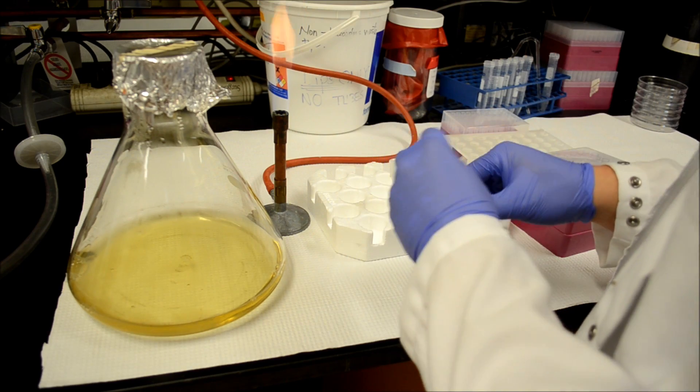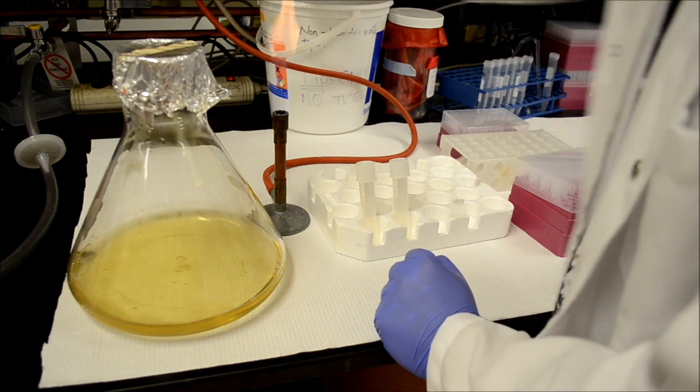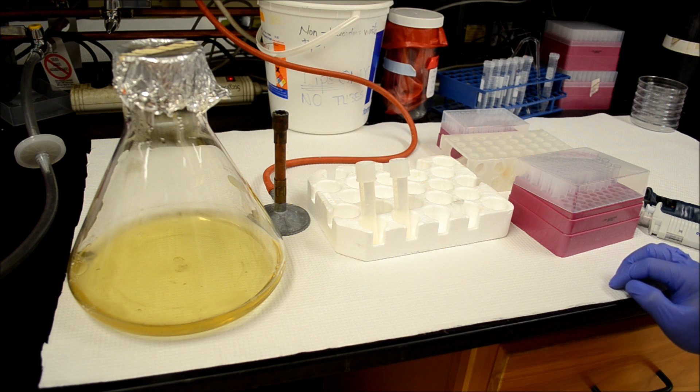After you're finished, always turn off the Bunsen burner, and also be sure to discard the bacterial tubes into biohazardous waste.